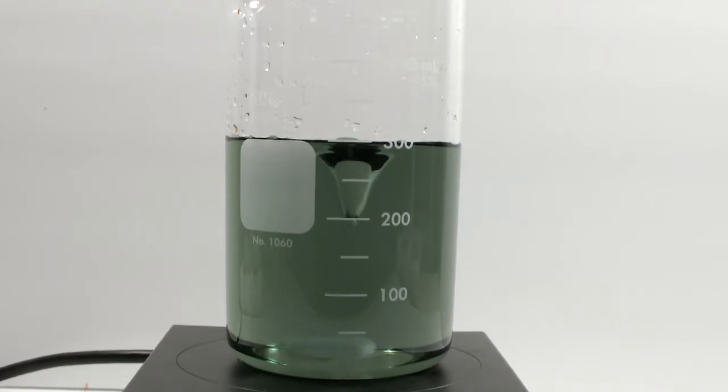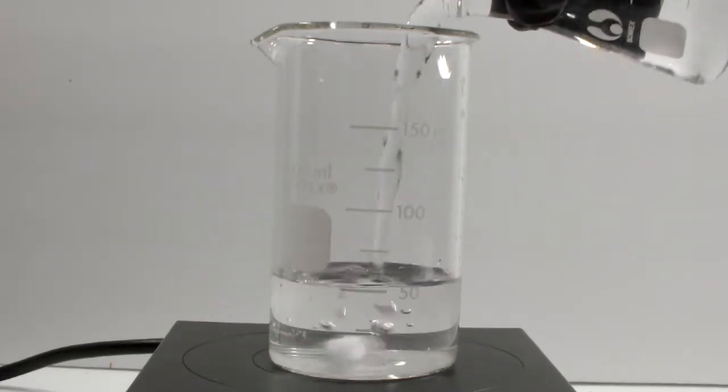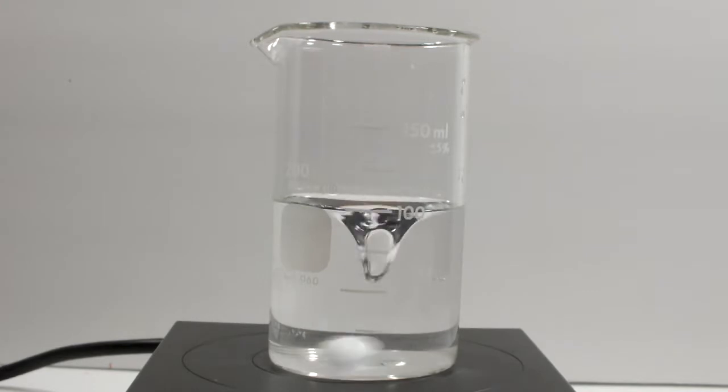In the previous video, we saw that the malonic acid solution might degrade a little in storage. I've prepared a 50 milliliter test batch of fresh malonic acid potassium bromide solution, and we'll see how that goes. Once again, I'm starting with the potassium bromate solution already in the reaction beaker. Adding the malonic acid potassium bromide still fails to produce an amber color. Well, let's add the cerium ammonium nitrate.